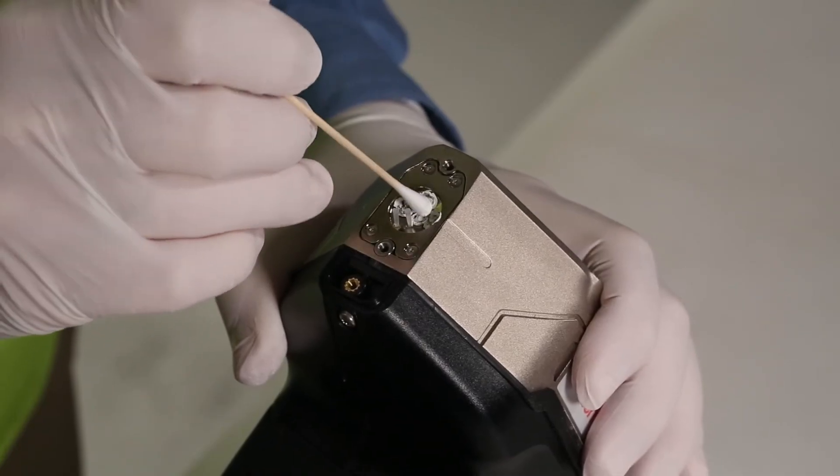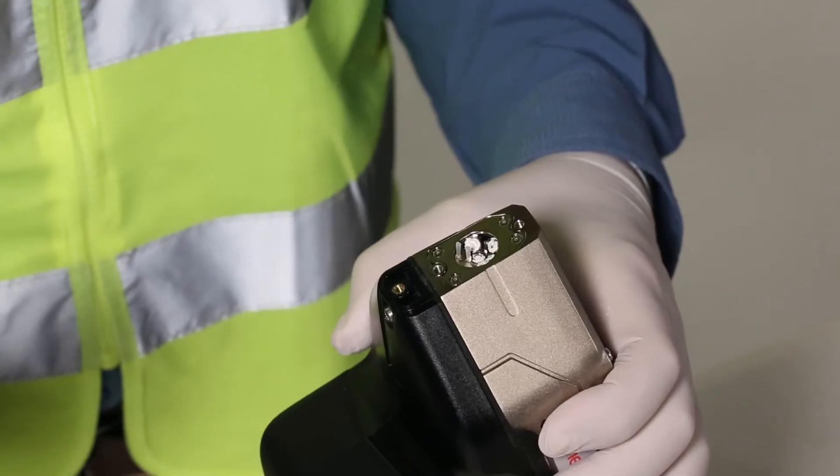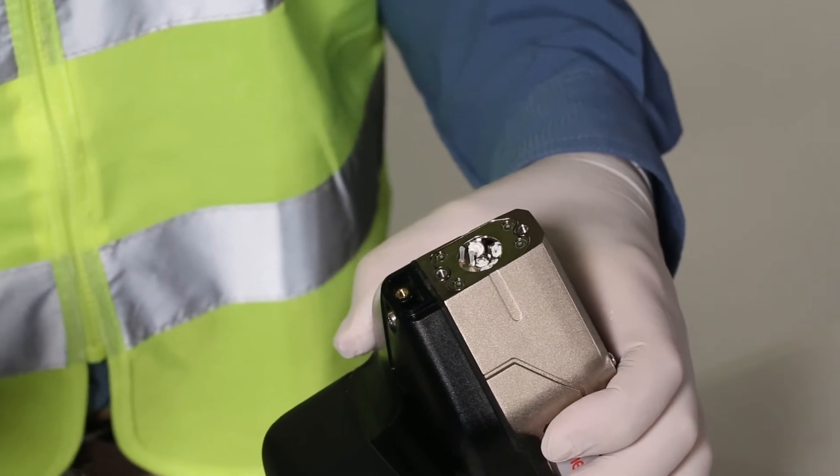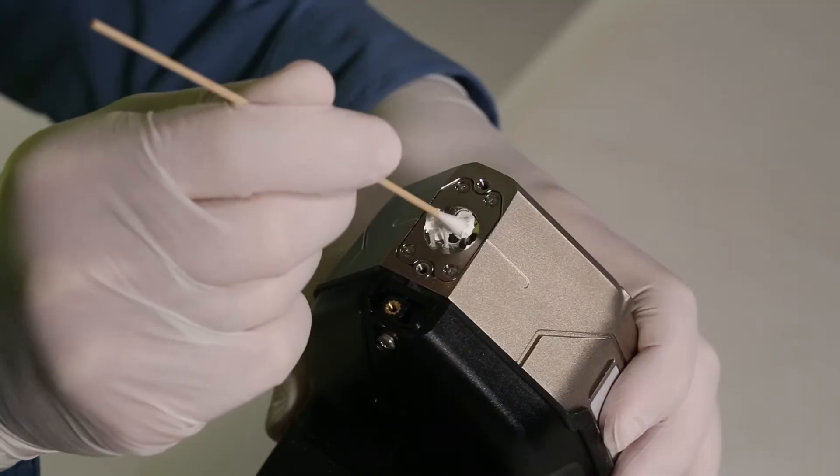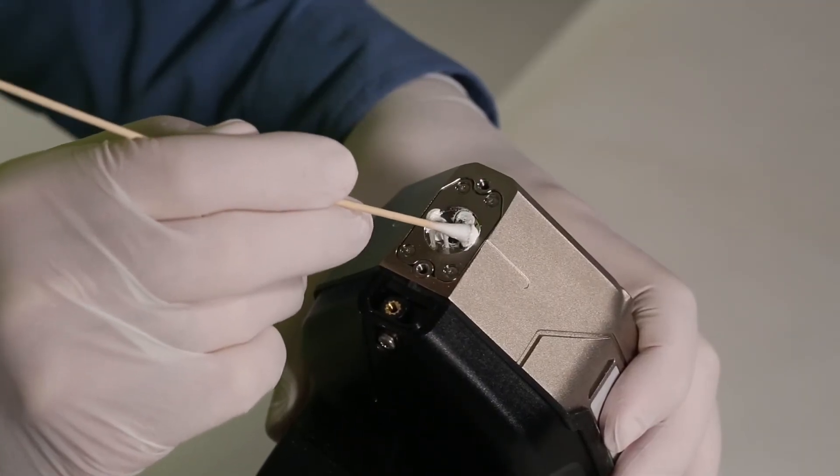Be sure to avoid any of the argon ports. Note that the cleaning mixture may dry in the sample chamber. If this occurs, use a clean cotton swab to clear the chamber and apply a fresh coating of cleaning mixture onto the windows.